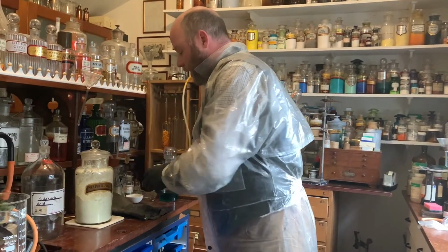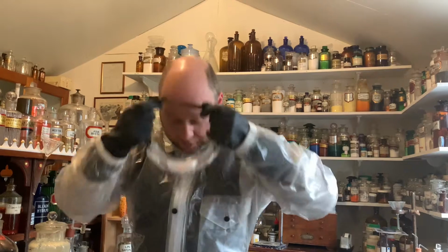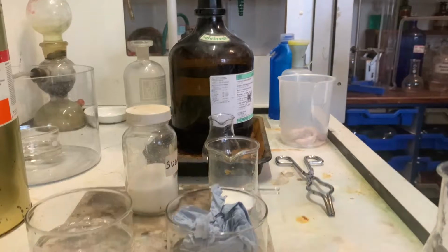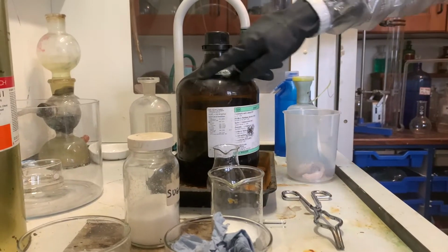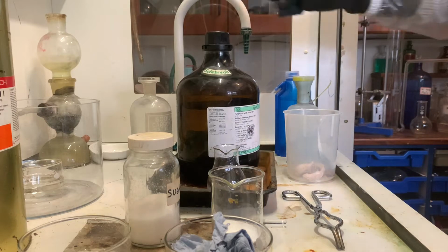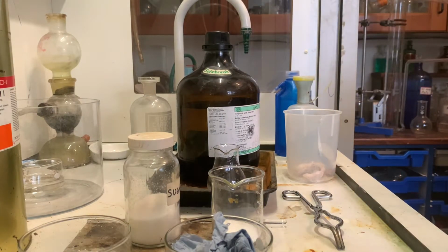Now, normally I would put a full face mask on, but because I'm speaking to you in the camera, I'm going to don these goggles just to keep my eyes safe, and I'm not using huge quantities of sulfuric acid today either. So my assistant is going to point the camera to the fume cupboard. You can see we've got 2.5 litres in a Winchester jar here. It's in a safe break jar, which means that that is coated with a plastic coating, so if the glass broke, the plastic would contain the sulfuric acid.